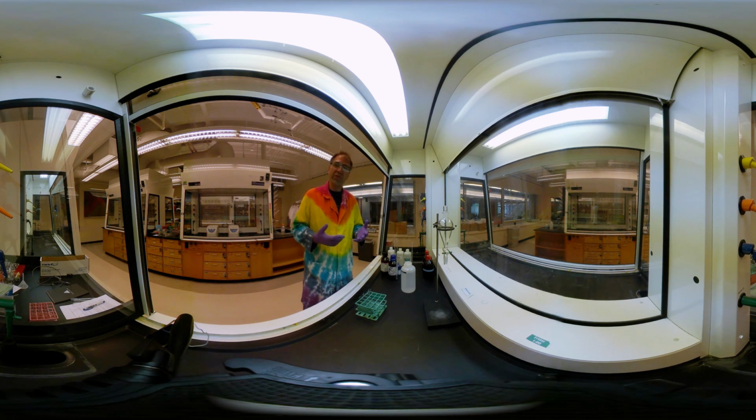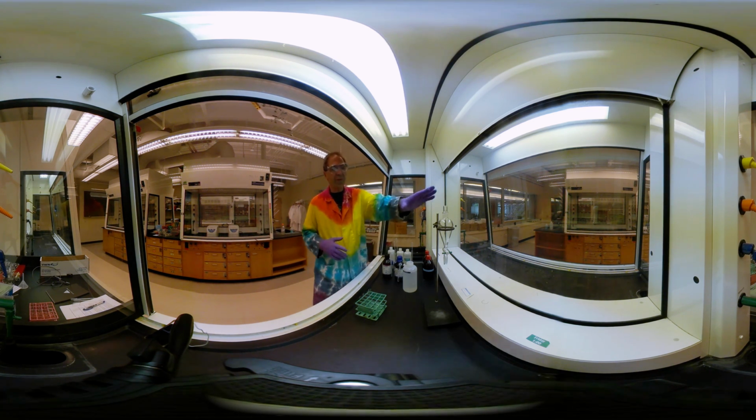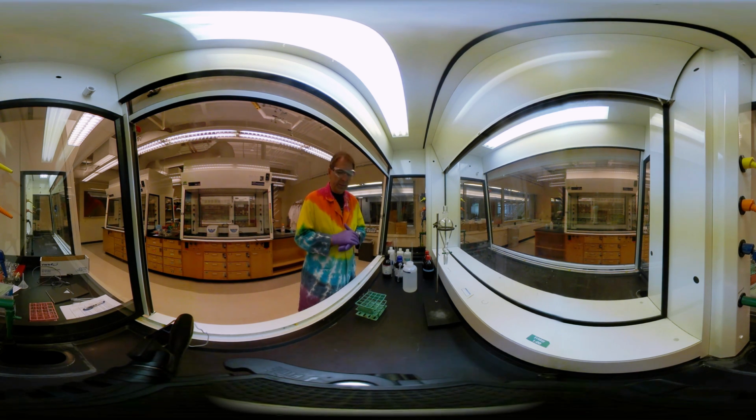But the first question is just to look at our solvents. And so I have 3 solvents I'm going to look at here. I have deionized water. I've got methylene chloride or dichloromethane, same thing there. And I also have hexanes. And we'll be using the separatory funnel that I have set up here for our experiments a little bit later on. But first we're going to start just by looking at how these solvents interact with each other.